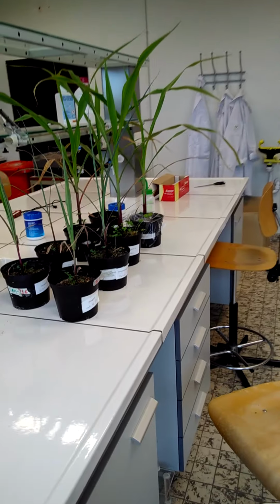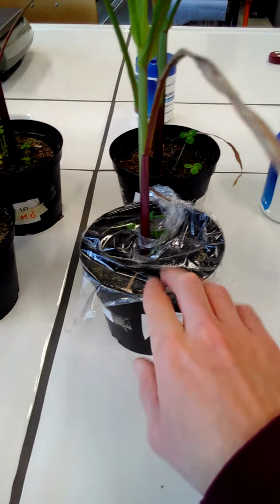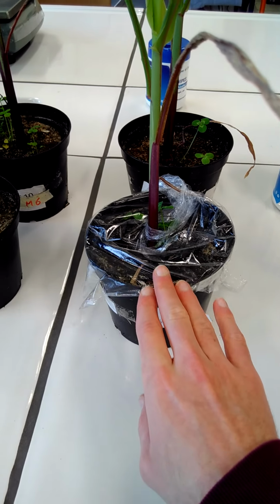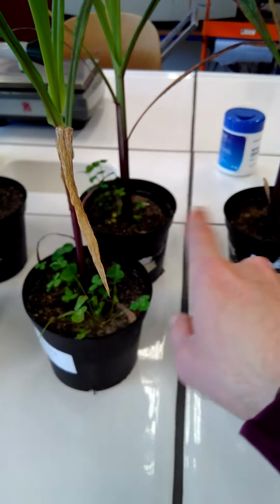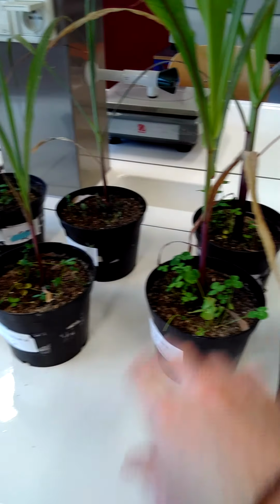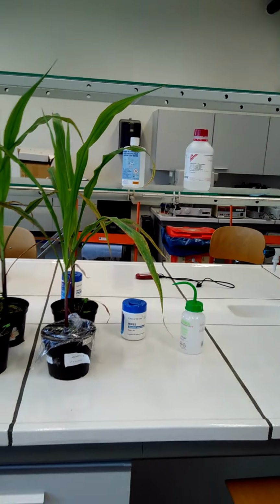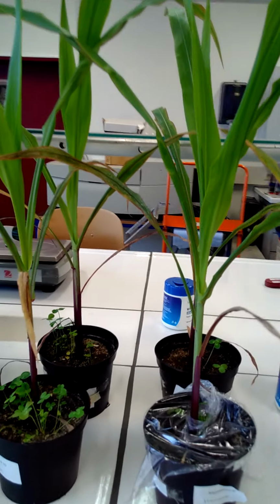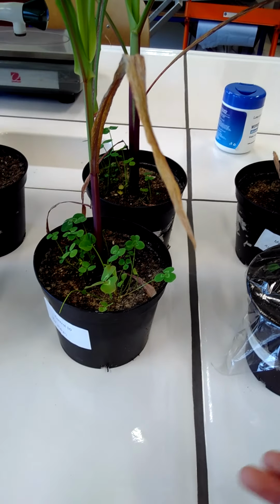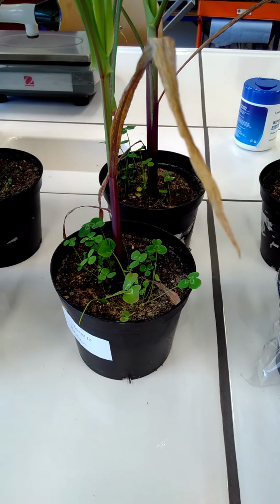All right. Now what you also maybe already noticed was that this plant here, I added a foil, and actually in the practical, for this demonstration, I will just work with this plant today. But normally you should add foil to all those plants or to the pots. Why? Of course, because we're only interested in transpiration and not in evaporation. And evaporation, that's simply the loss of water from a water surface or from the soil.